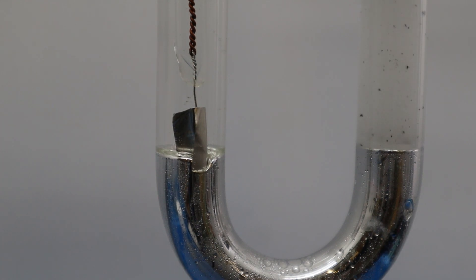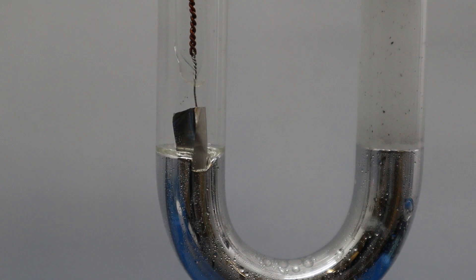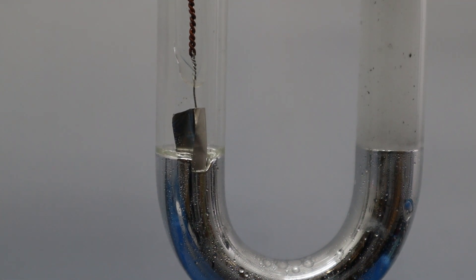So the surface tension of mercury is much larger than that of water. So I suspect that the reason for almost no gas bubbles rising from mercury at the first 10 minutes is due to the high surface tension of mercury.